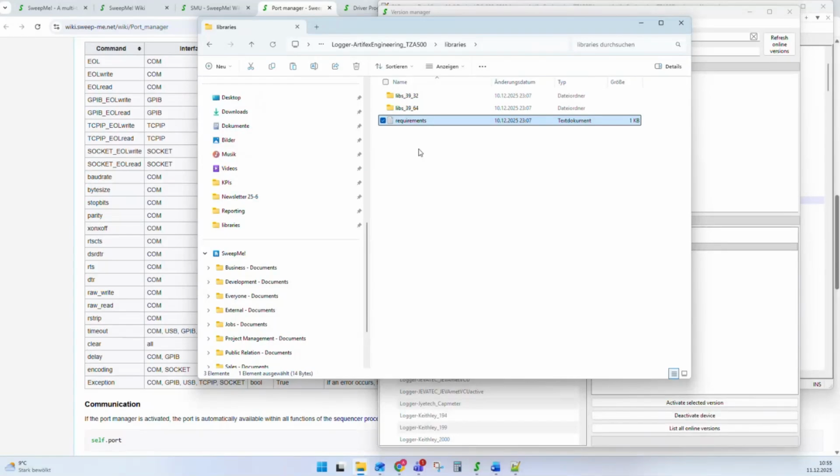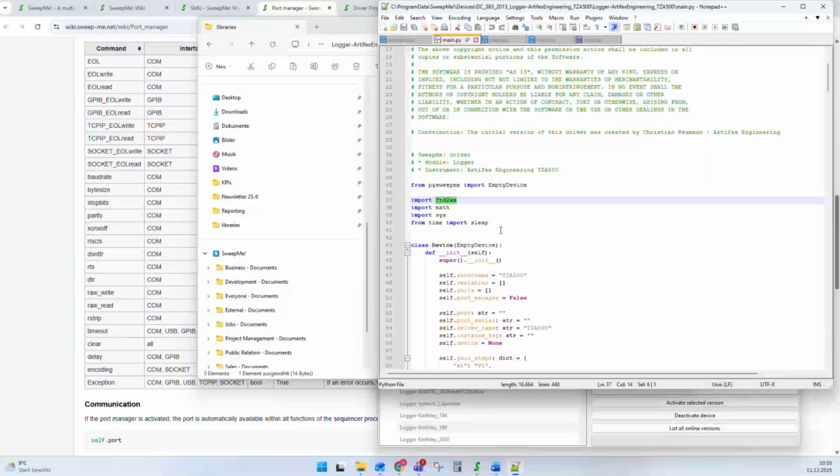Because of time, and we have just 5 minutes to go, I cannot really go into the Library Builder details, but you can find this also in the wiki. Another way of adding a library is you can basically do it manually. You can simply add your library to the libraries folder. When SweepMe detects a library folder, it will add this folder to the Python path. So Python will have a look into these folders whether there is a library, and then you can really just import your library. Again, we try to make driver writing as convenient as possible, to add libraries and use them.